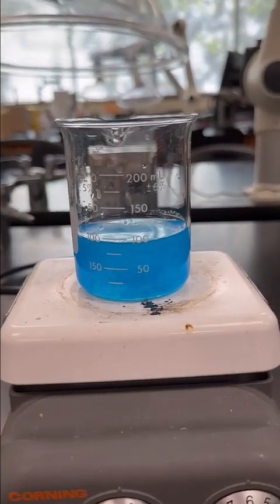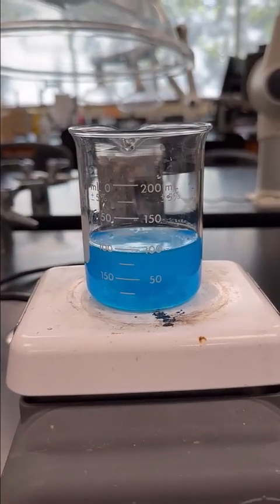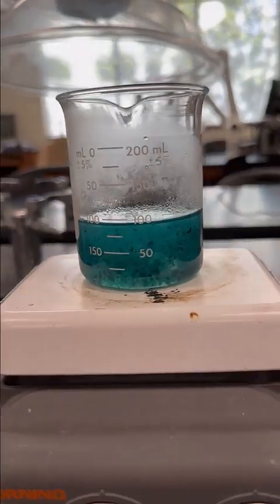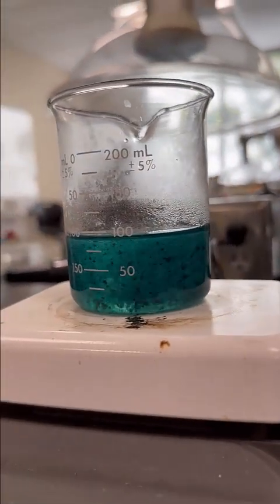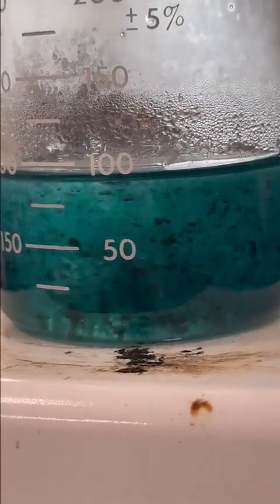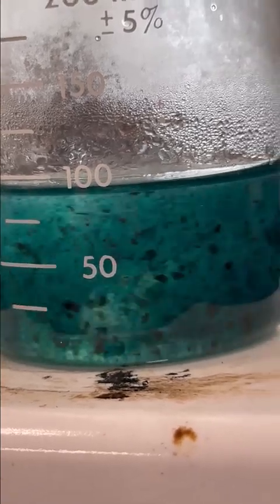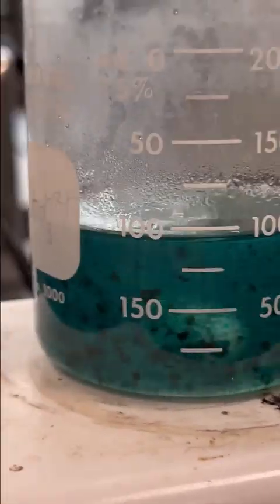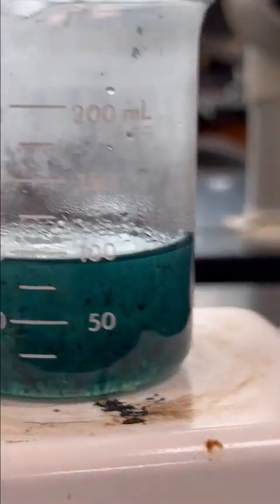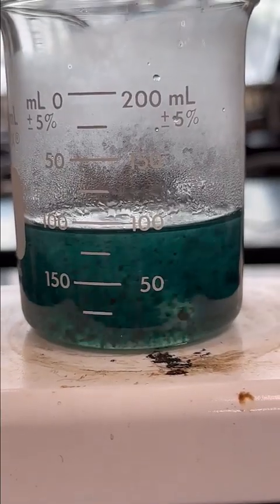We are at about 30 seconds of heating to 1 minute, and that is our monitoring for this step. And we are at about 4 minutes of heating. You can see our solution is starting to change now. Those nice fluffy blue particles are starting to turn black. And we need to continue heating until it is completely black and all of that blue color is gone. So it should only be a couple more minutes now.